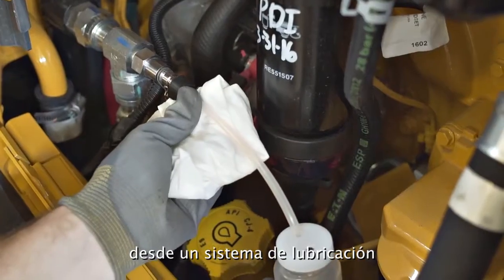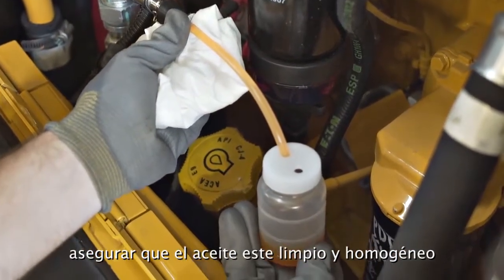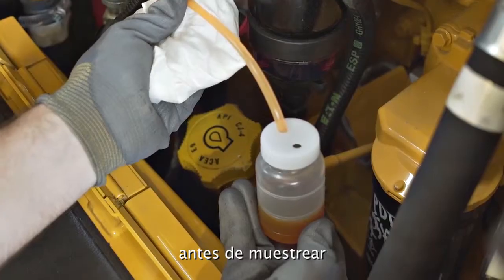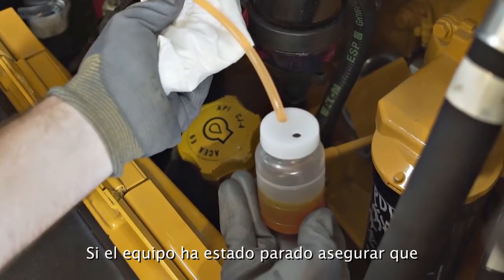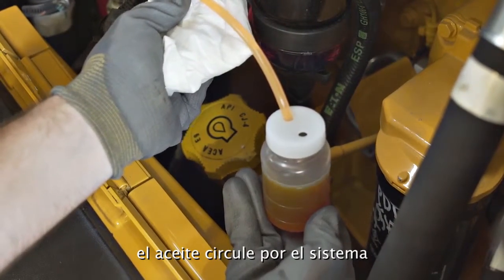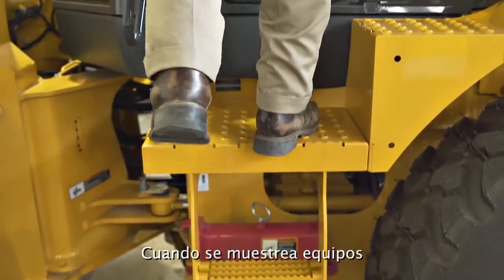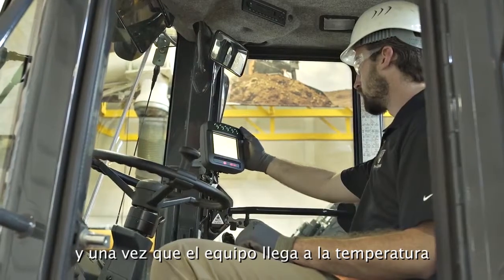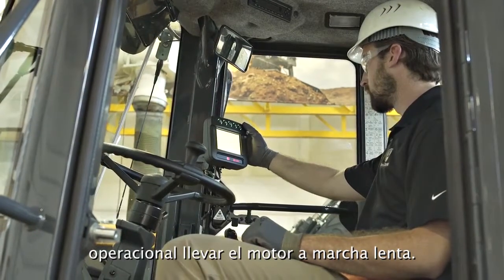When obtaining a sample from a lubricating system, always have the oil warm and thoroughly mixed before sampling. If equipment has been idle, cycle functions so that the fluid is agitated throughout the system. When sampling mobile equipment, once the system has reached operating temperature, set the engine to a slow idle.